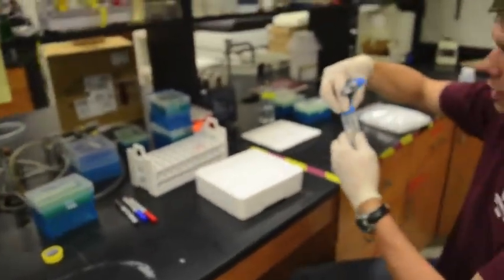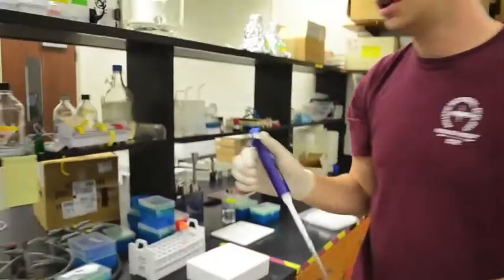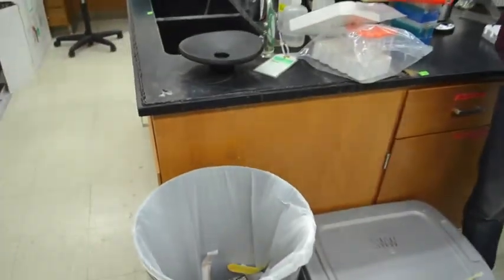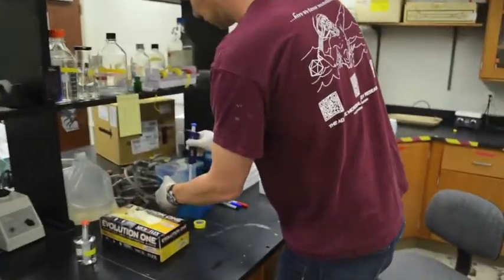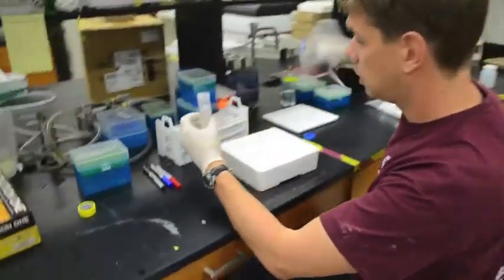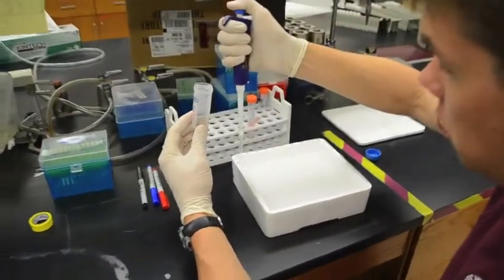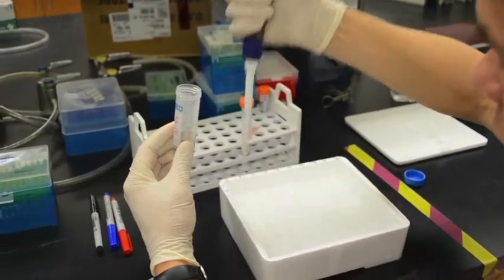And then I don't want to contaminate my killed control with any live water from the pipette tip, so I'm going to throw away the pipette tip, and we can just do this by pressing down hard onto the button. Oh, sorry, this one, where it ejects. And I've let this killed control cool down because we don't want to put it in when it's hot. That might cause the substrate to break down and emit more fluorescence than it's supposed to.